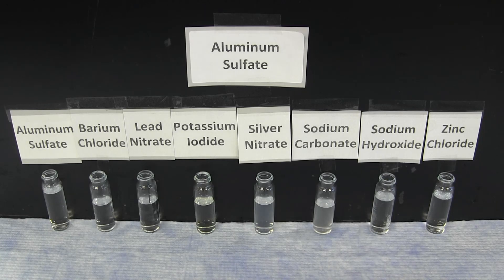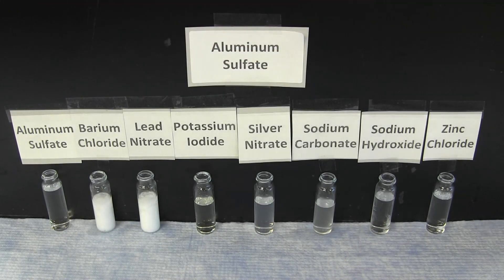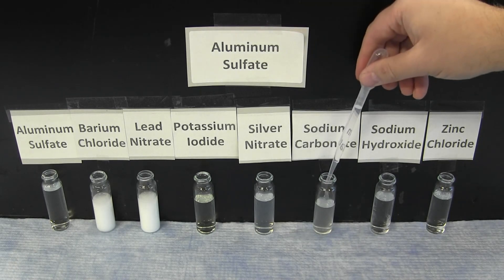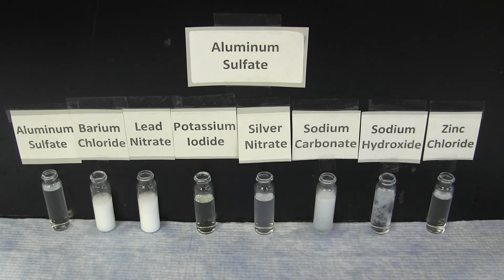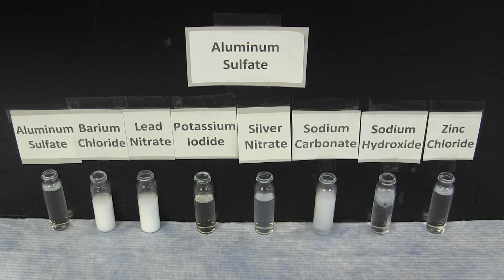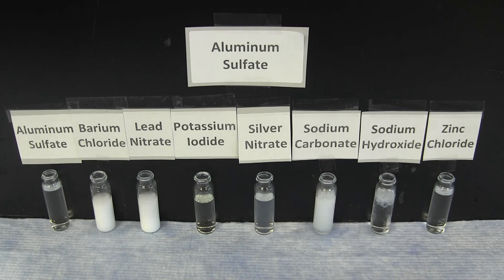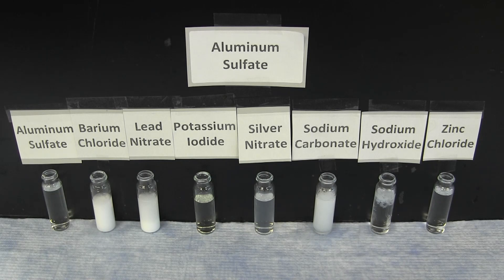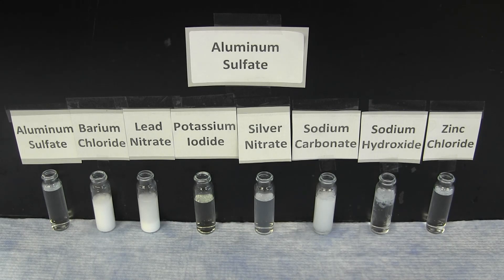The first reaction set is with the aluminum sulfate solution. Overall, the aluminum sulfate forms a brilliant white precipitate with the barium chloride and lead nitrate solutions, as well as additional white precipitates with sodium carbonate and sodium hydroxide. All of the other solutions — potassium iodide, silver nitrate, and zinc chloride — give no precipitate.